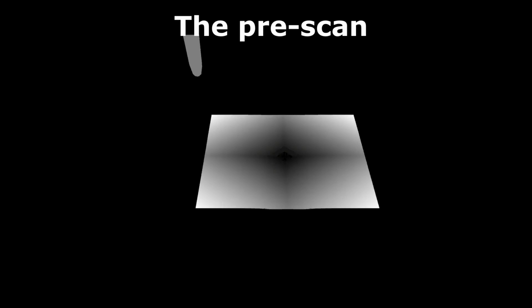For this we have three different measurement data that are important. We have the pre-scan. And what is the pre-scan? It is when you go over your material before the actual scan, before the actual scratch, to see how your surface and the topography of your material look. That's basically all there is to it.